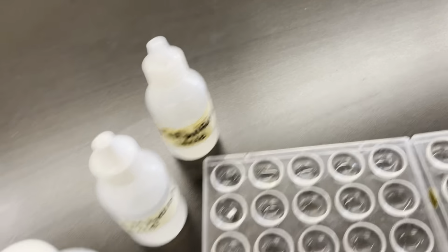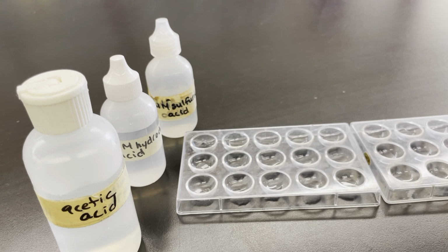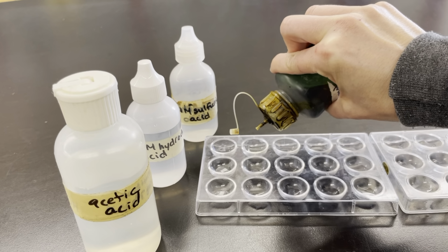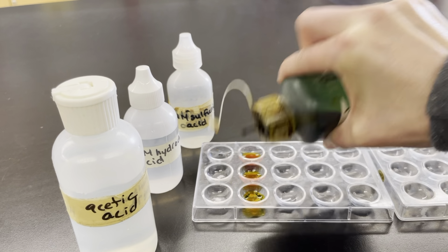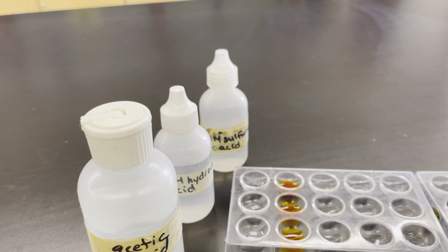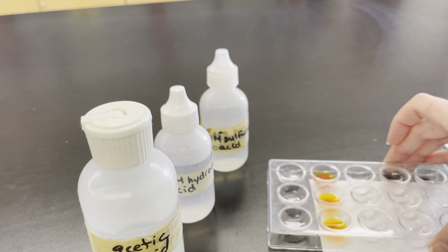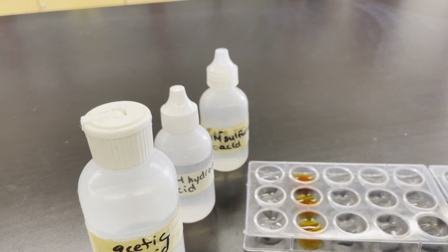The next thing we're going to check is what the reaction is like with bromothymol blue. You can see it's a blue color before I put it in. And we have an instant color change. We can maybe see the color change a little better if I put a piece of paper underneath. Very, very vibrant, like a dark yellow, almost an orange color. Very yellow. It's very concentrated, I think.